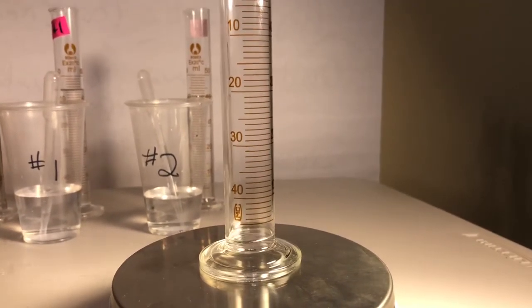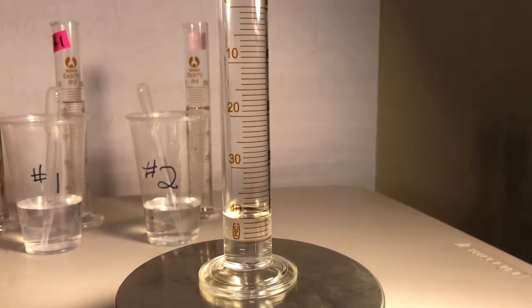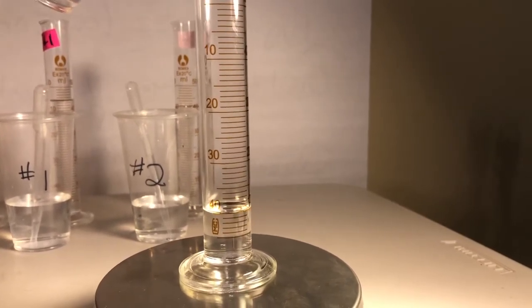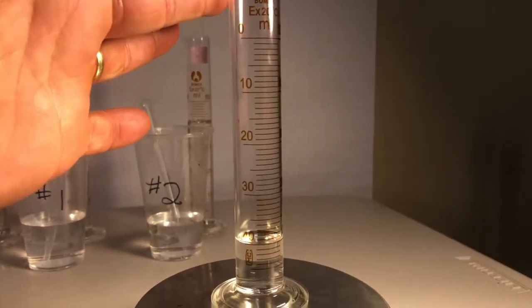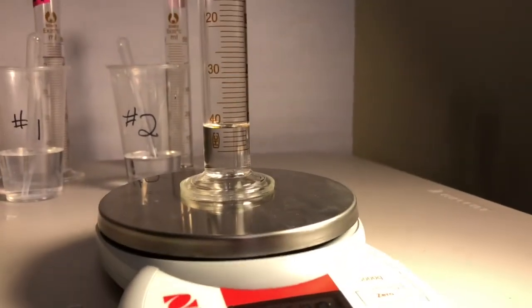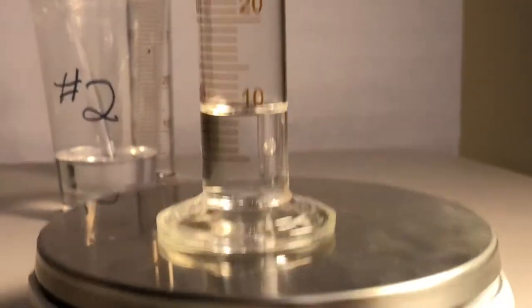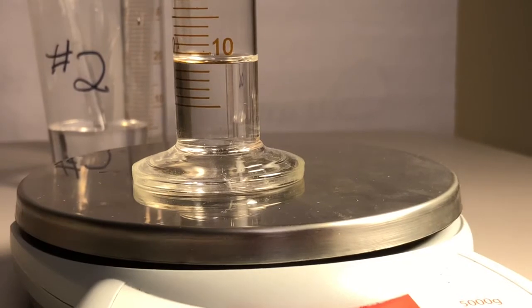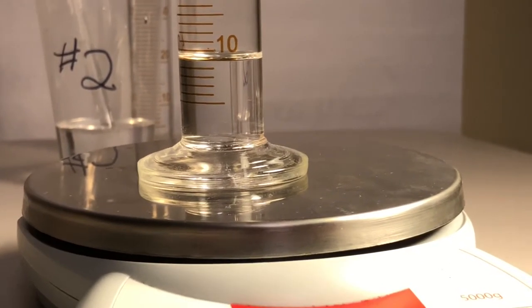Let's do a pour for the first one. That enough to read? I think so. Get off of there. All right. Oh, it's on the inside. We're good. Okay, first data point looks like that. Let's zoom in a little bit. We got to turn that because it reads upside down too if you want it to. But we want to read right side up. Ooh, that's an interesting little one, isn't it? What's that going to be, you guys?